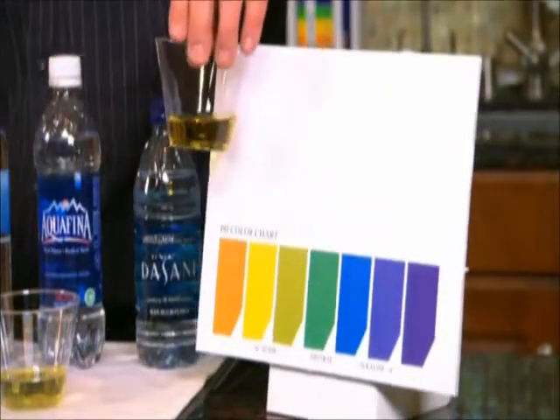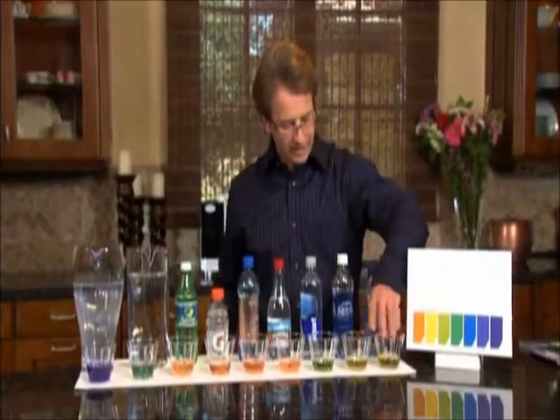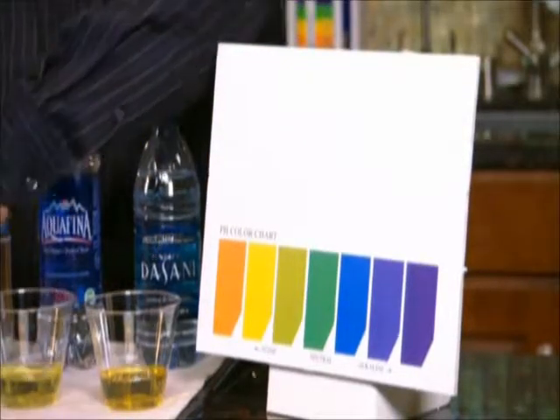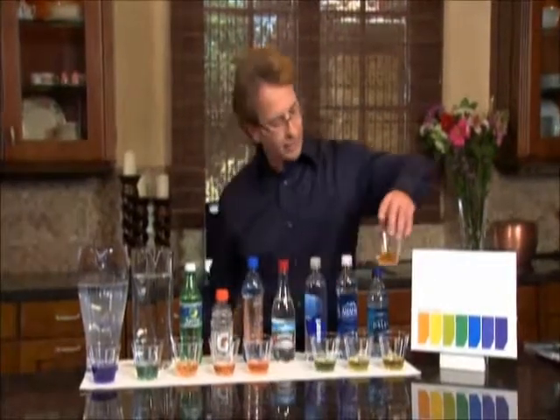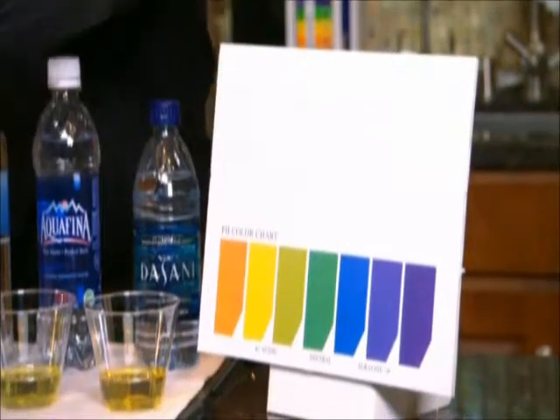So the Dasani is what? Very acidic. On the acidic side, right? How about the Aquafina? Acidic. Also acidic. How about the Smart water? A little better, but still acidic, right? How about the Arrowhead Sparkling? Very acidic. How about the Alive water?